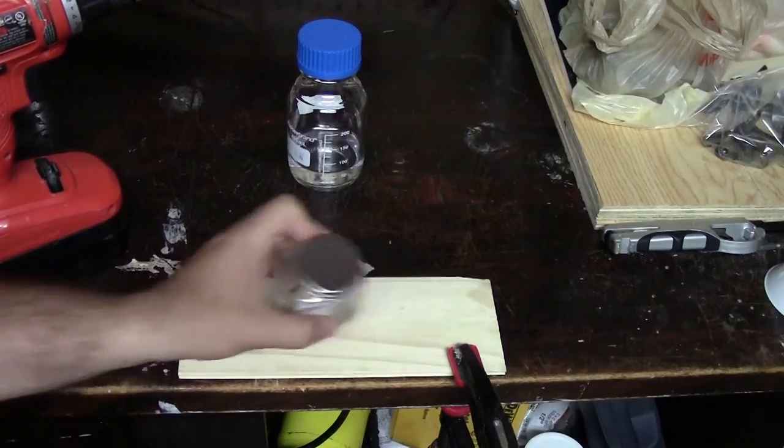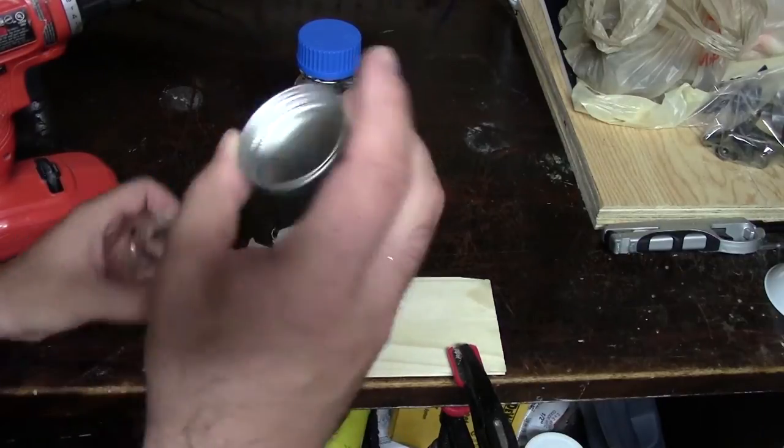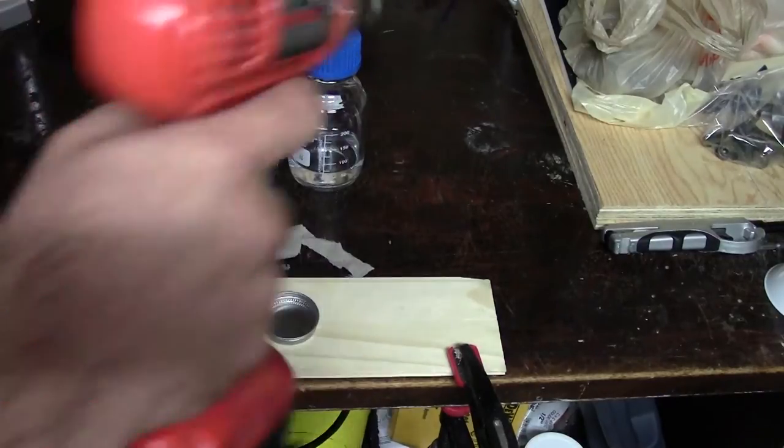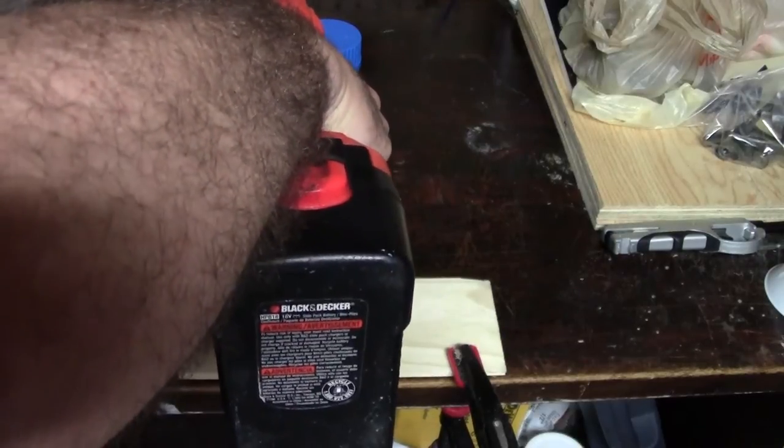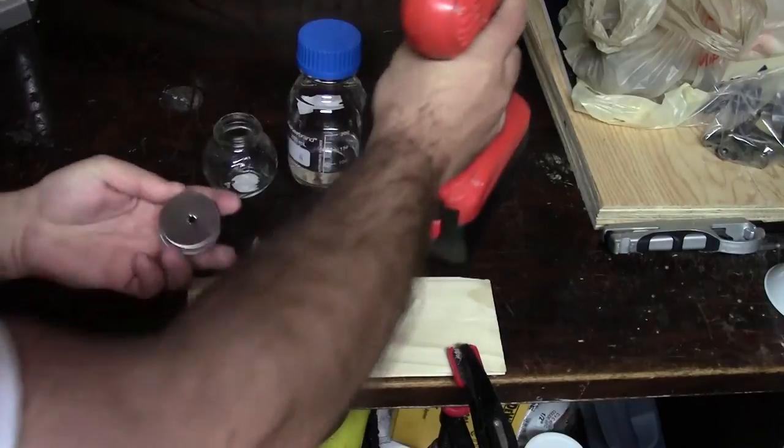The process of making these is pretty simple. Take your lid off of your jar and just drill a hole in the center of it, just like that.